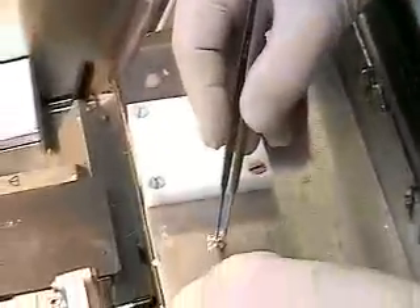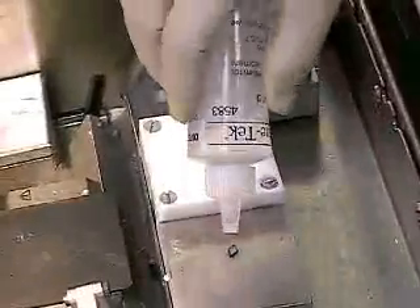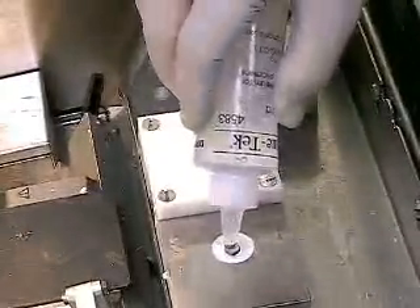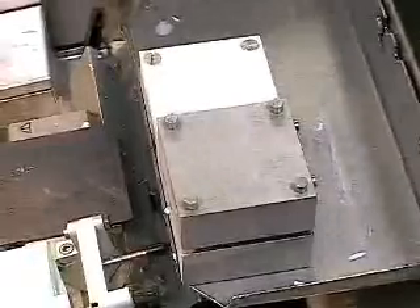I will place the tissue again with the face down right on the griddle. And then very quickly I will cover and surround the tissue with a quantity of mounting medium, embedding medium. And then I will place it over the elevated freezing block. That small specimen will be frozen in a little less than a minute probably.